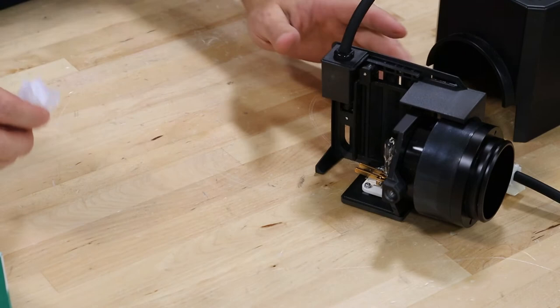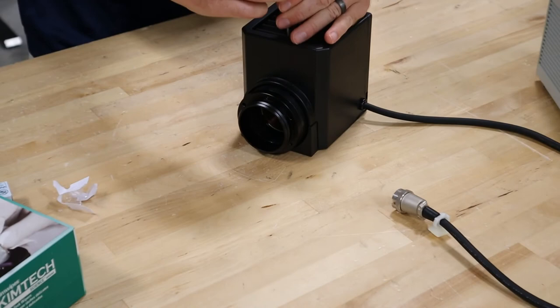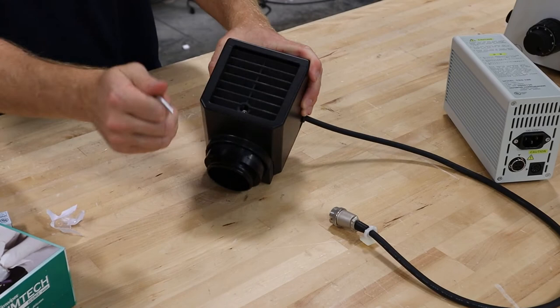Let the lever up and then remove the plastic. So once that's done, your bulb's changed, it's ready to use. Take this lamp house cover on, slide it down, three millimeter Allen wrench, tighten it up. That's kind of what it looks like — you'll feel it snug, try to lift it off, make sure it's good and tight.